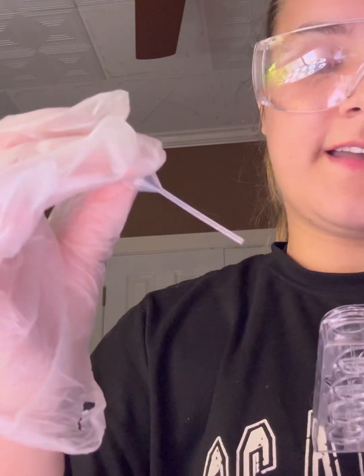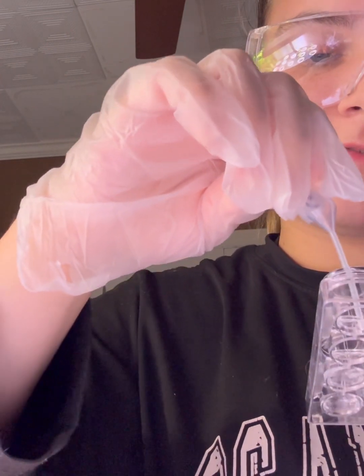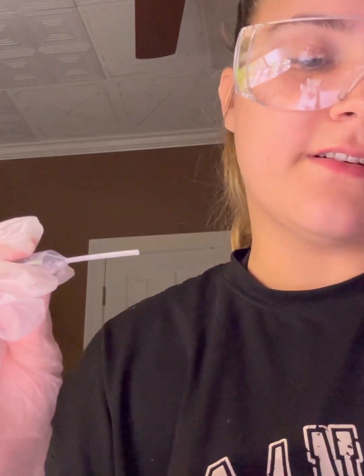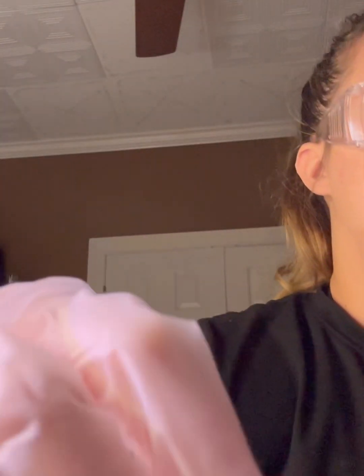So I will slightly tip this and then take this HCl out and put it into the HCl pipette. And I guess we're going to do what we did with the last few experiments and place all this HCl inside C4, D4, C5, D5, and then C6 and D6 and put it on our data table to check the average reaction time. And so let's get started.